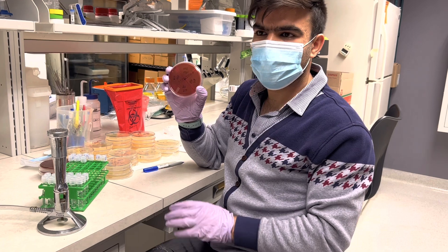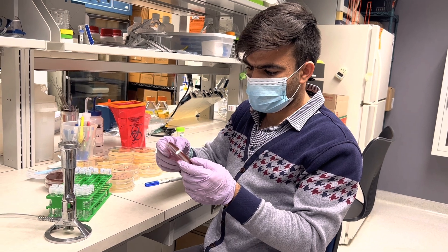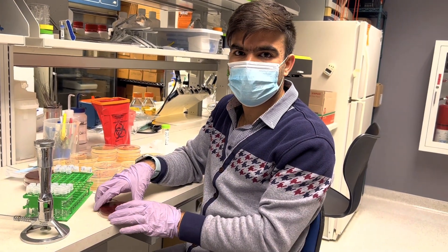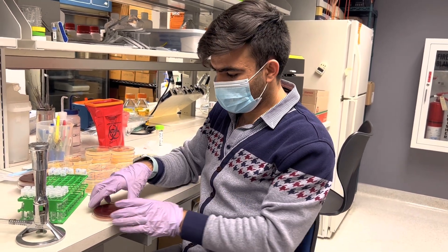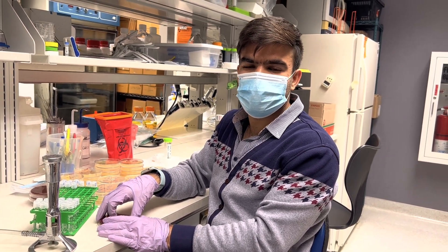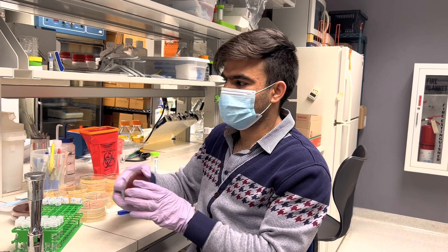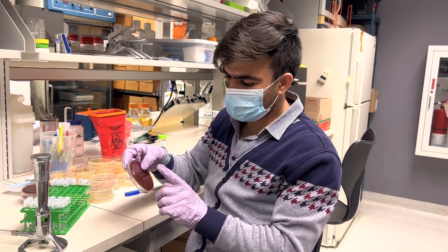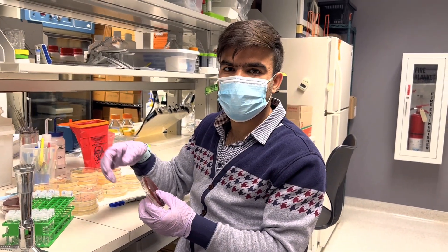Here I have E. coli isolates which are positive for AmpC and ESBL. It means that they are ESBL and AmpC producers — the two most important beta-lactamases. They were stored in the freezer at minus 80 degrees Celsius, then refreshed on blood plates and incubated at 37 degrees Celsius overnight. Today I want to determine their susceptibility to other antimicrobials.